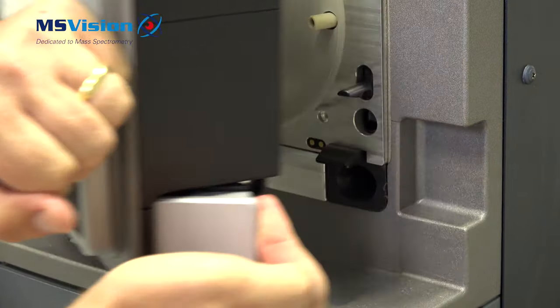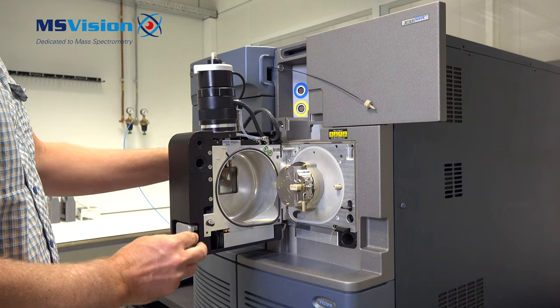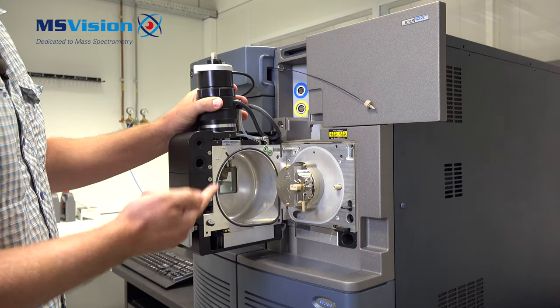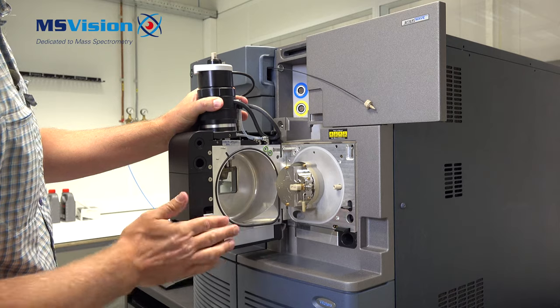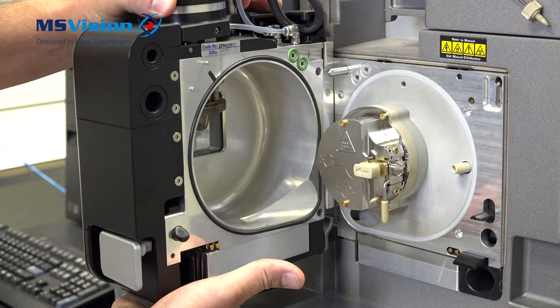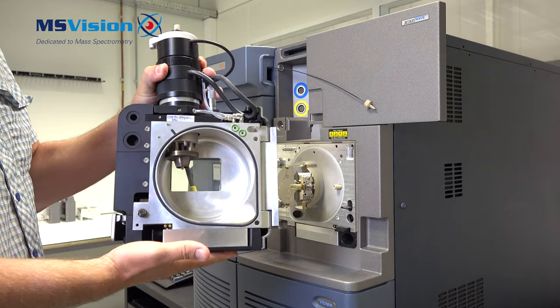Open the source enclosure door using the lever, hold with both hands. Be careful it might be hot at least here on the bottom side. We can remove by lifting up and then pulling towards you.